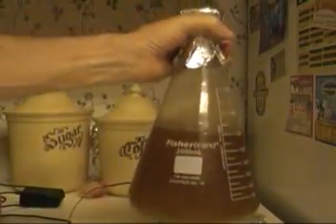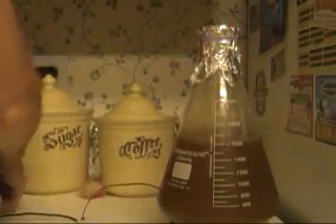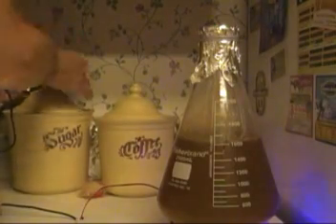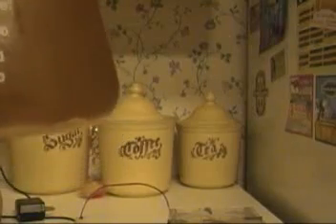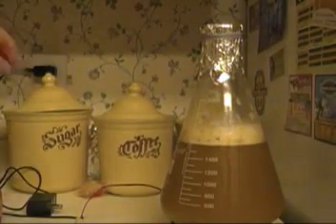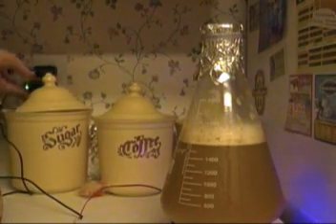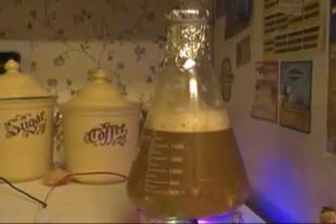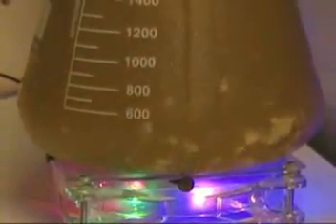I had a little problem here — I tried to line up the magnet and plug it in but it didn't start spinning because the yeast on the bottom wasn't allowing the stir bar to do its thing. You can see a layer of foam on top because I had to shake it pretty hard to get all the yeast broken up into little chunks so it would spin. I got it spinning — the flocculated yeast is doing its thing.